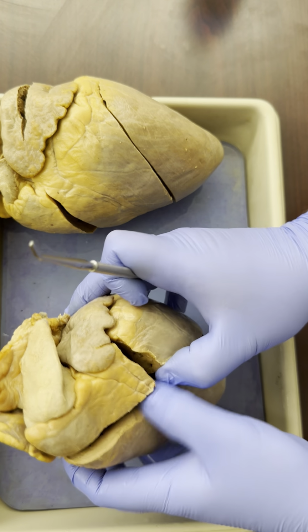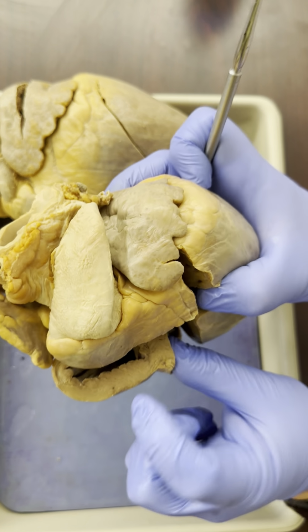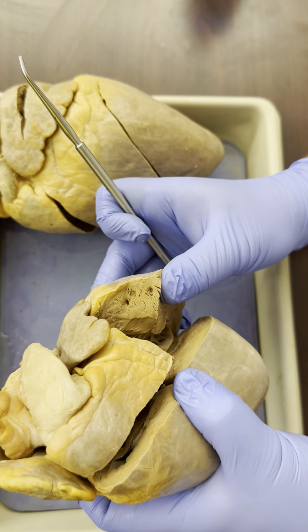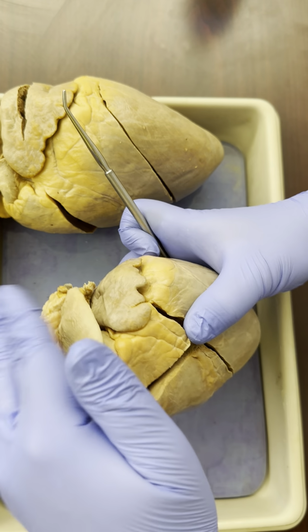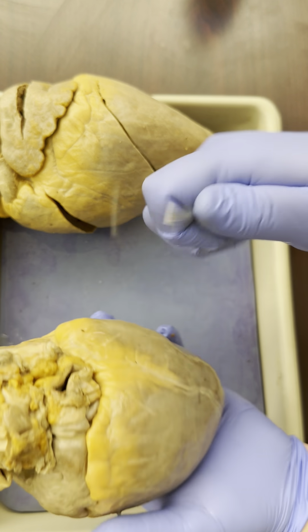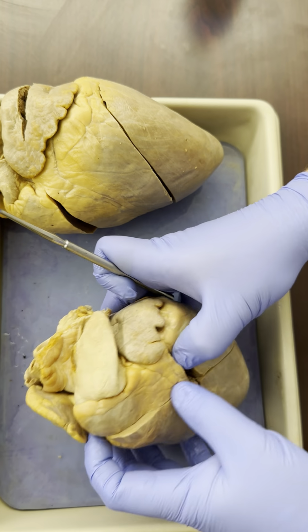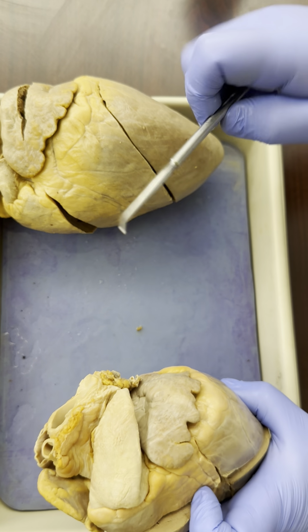And lastly, see what's thicker. Well, here's the right ventricle, pretty thick. Here's the left ventricle, much thicker. So right, left, top, bottom, coronary artery front, back. All right? So what can we see here? We can see everything that we saw on the other plus some.